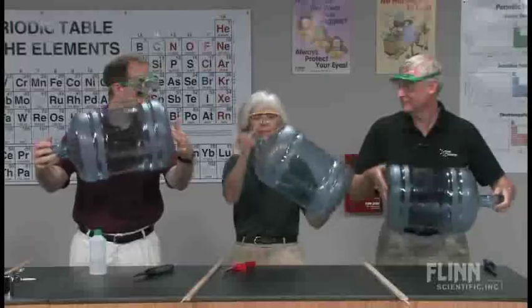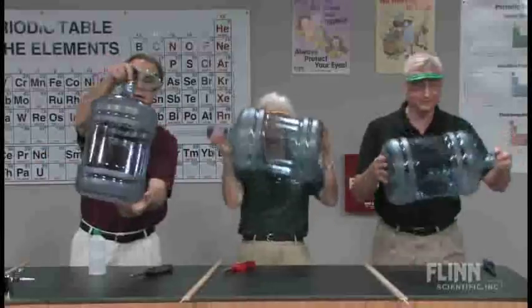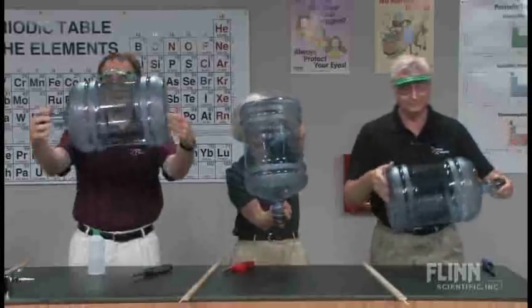Shake, shake, shake, shake, shake. Round and round. It's important, as you do this demonstration, to ensure that you have the neck of the bottle adequately coated as well, so that you'll be able to light the vapors.